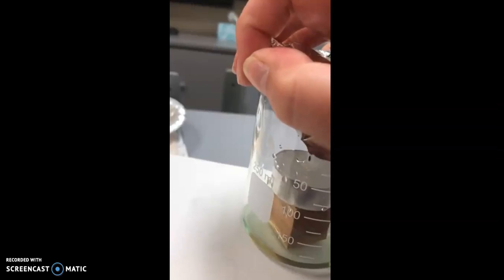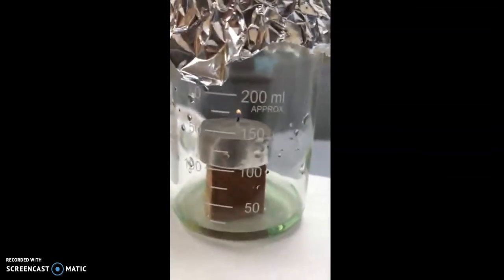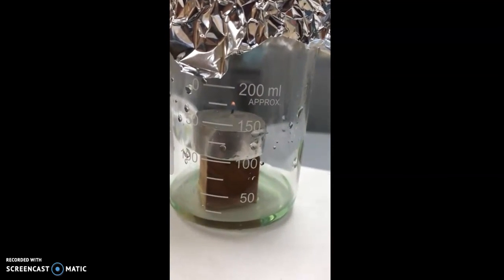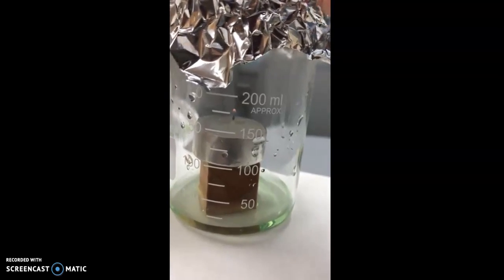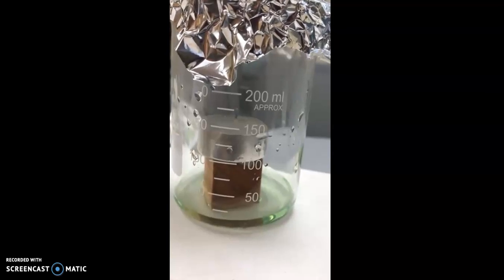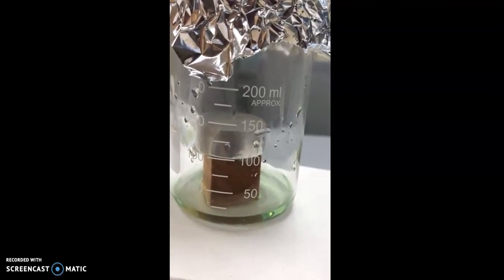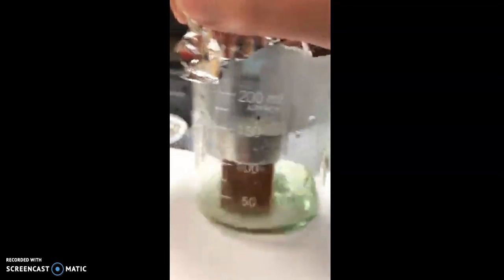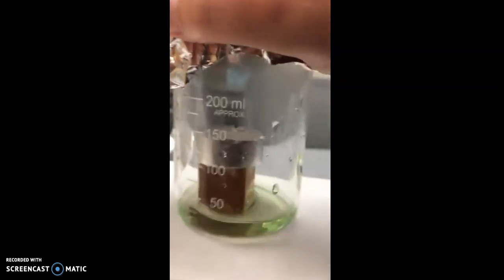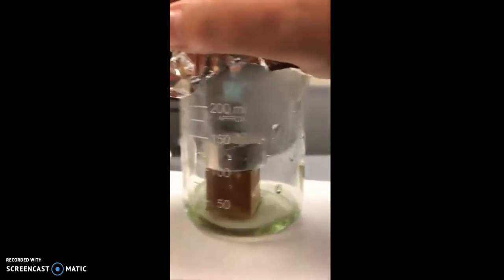We're going to cover it over really good. Continue to watch the flame and see what happens, and also you'll start to notice something happen to the color of the bromthymol blue. As you can see, the candle is getting weaker and weaker. Think about why the candle now has gone out, and that's because it could not get any more oxygen. So as we're swirling the beaker, the bromthymol blue goes from a more bluish color to a more yellowish color.